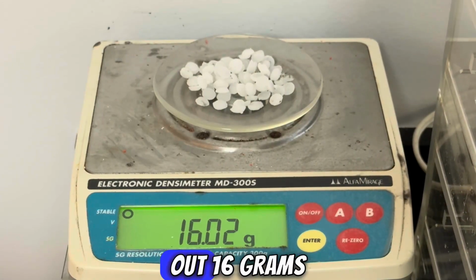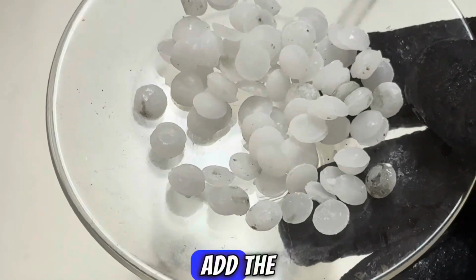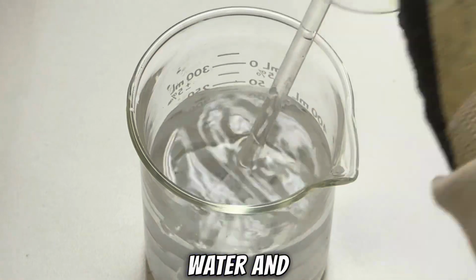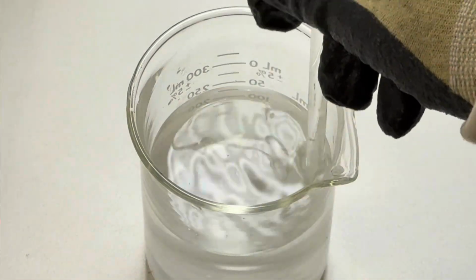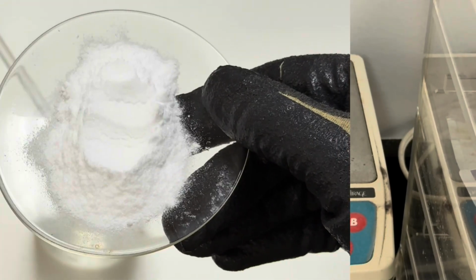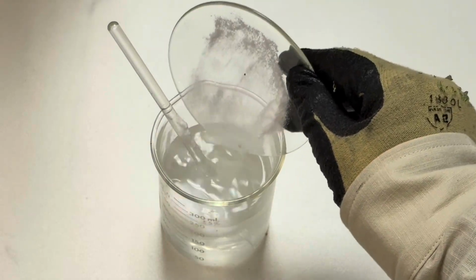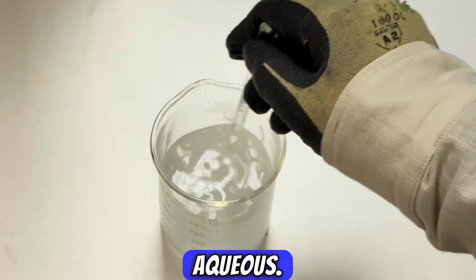Begin by measuring out 16 grams of sodium hydroxide. Add the sodium hydroxide to 250 milliliters of distilled water and stir until aqueous. Then measure 10 grams of glucose. Add your glucose to your solution of sodium hydroxide. And again, stir the solution until it's aqueous.